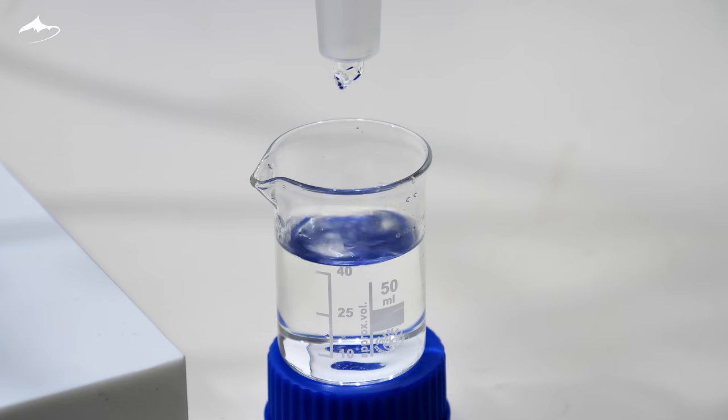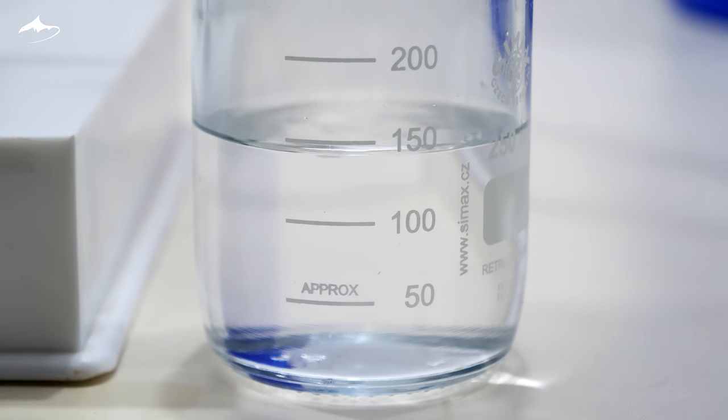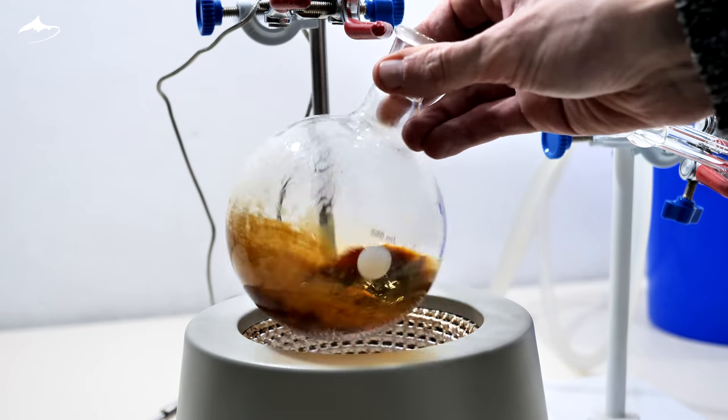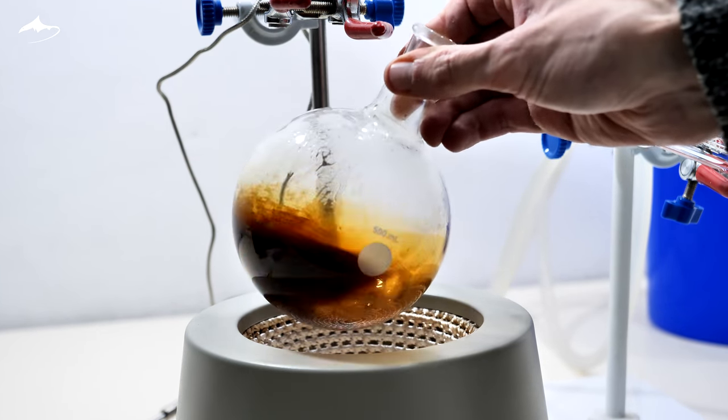Almost 50 ml was discarded and the rest was collected in a separated bottle. Luckily, the remainder was easily washed from the sides of the glass with a little bit of acetone.